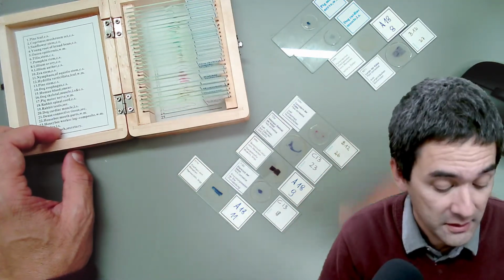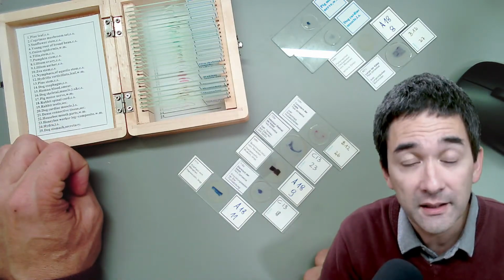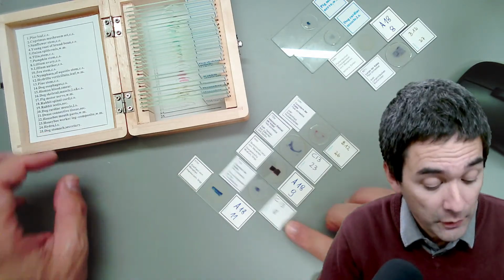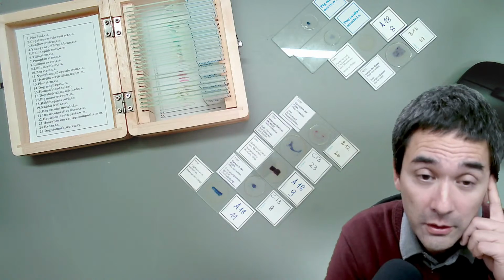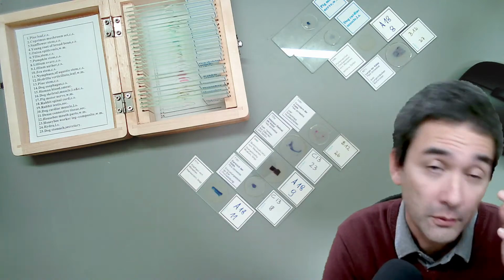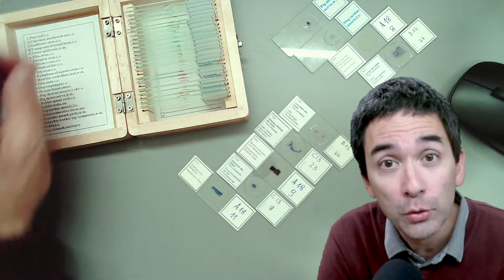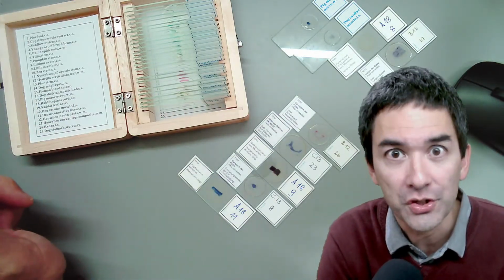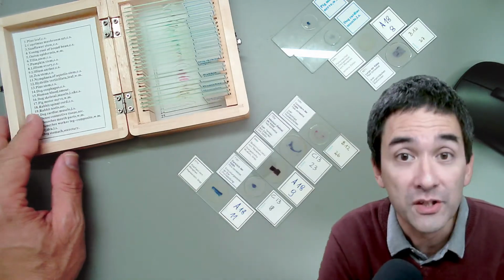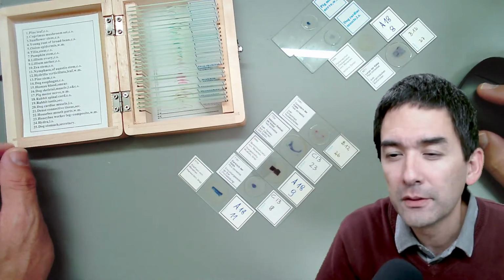Okay, and some of the slides can be quite expensive, and I checked the website of the company, and they said that for some slides you actually have a waiting time because they have to manufacture them and make them. Yeah? And I remember also that once I went to a local microscope shop, and they basically said that they also have slide boxes just for human anatomy, of all different types of tumors. It even goes that specific. So actually for med students, for medical training, so this is the thing.